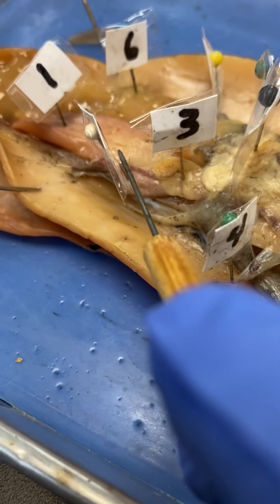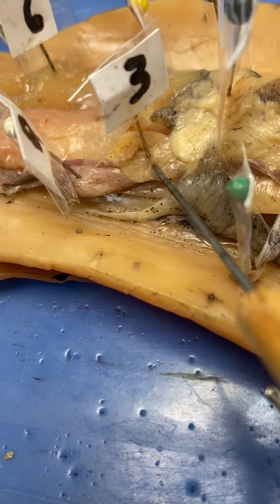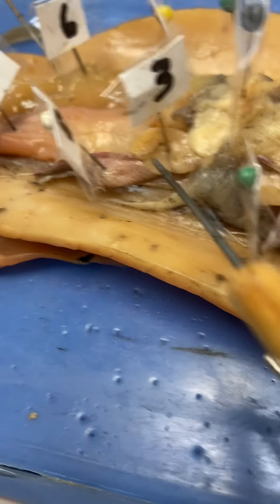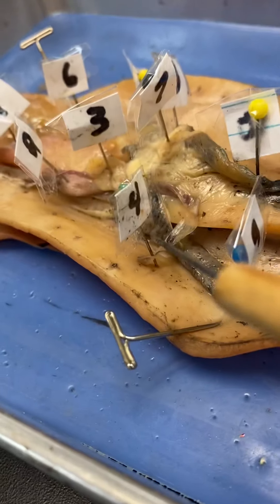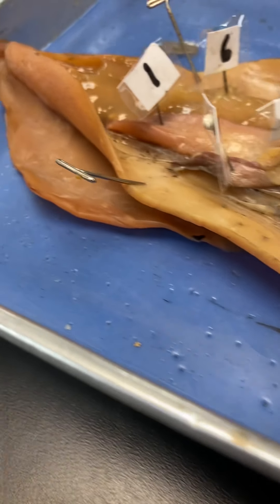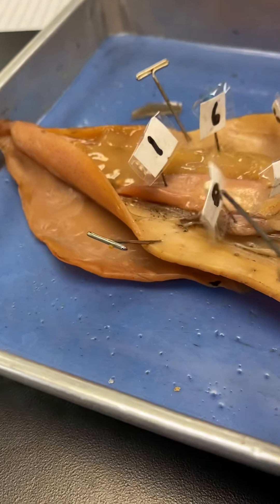I don't have them all labeled, just some of the major ones. Number one, this pinkish look — that is the testes right here. Number two, there's a whole bunch of coiled tubes; you can see the pink part right here. That's a whole bunch of coiled tubes — that is the vas deferens, where all the sperm kind of travels through after it leaves the testes.